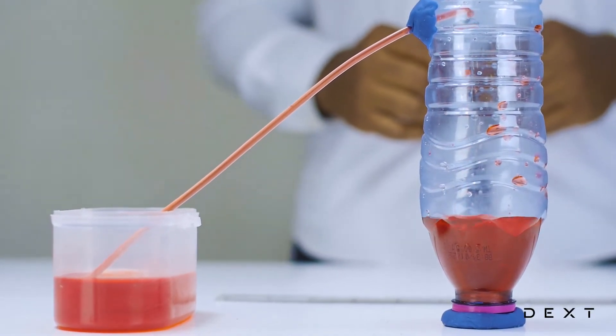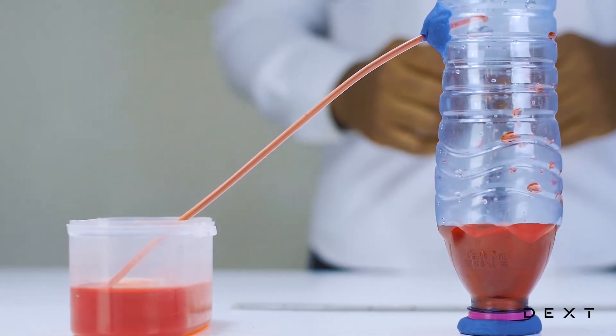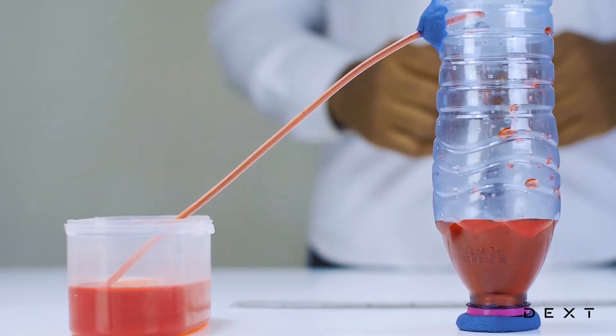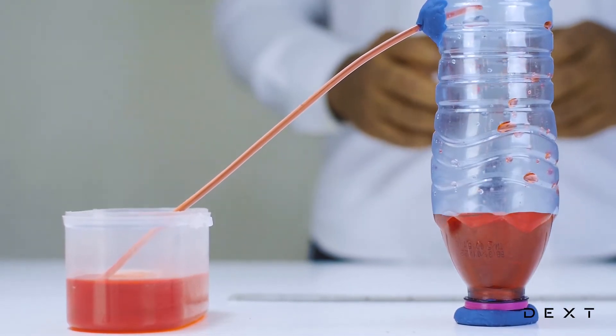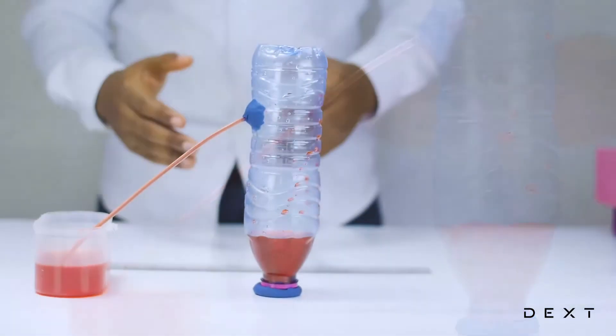So this experiment helps us demonstrate that indeed, oxygen does support burning. And that that oxygen has been consumed, creating a space that this water is rising to fill. Really interesting activity.